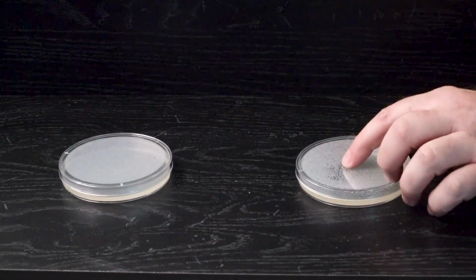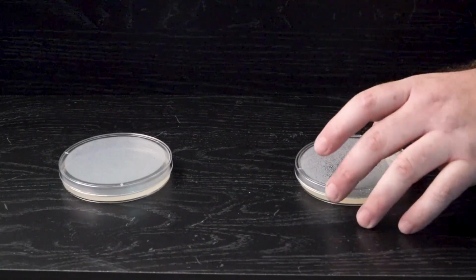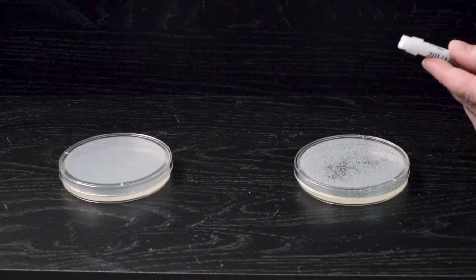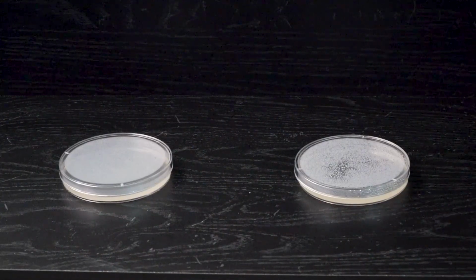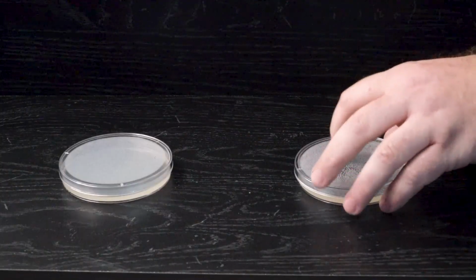All right, I have both my Petri dishes here that have been solidified, so each group would have a certain amount of them. There are quite a few antibiotics that we have, and you can see a list of those in the lab itself, but they come in these little vials that look a lot like this. This particular antibiotic is going to be added to this, but I need to label a couple things first. So I'm going to take a Sharpie and make a little X on the bottom.